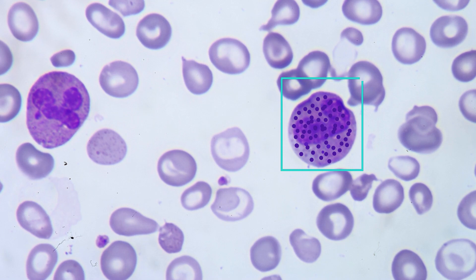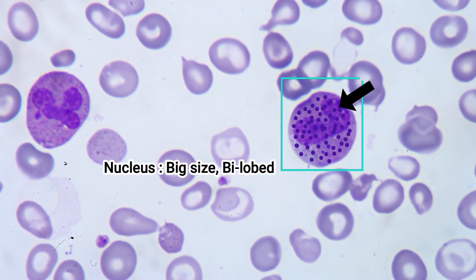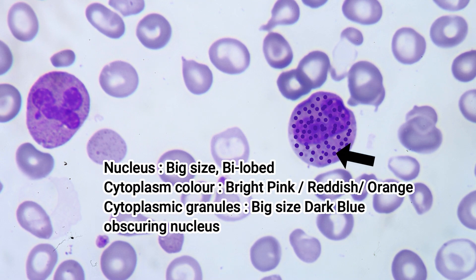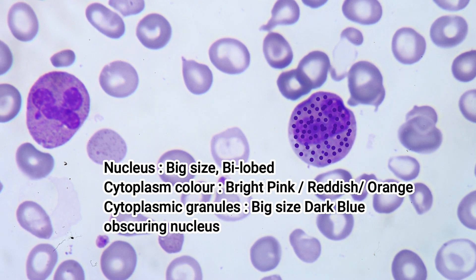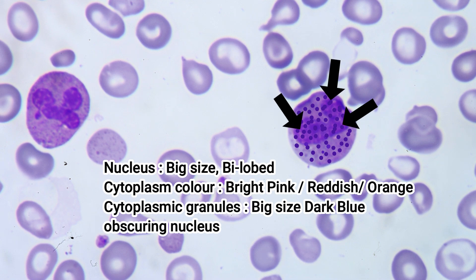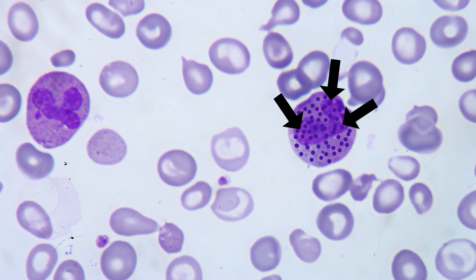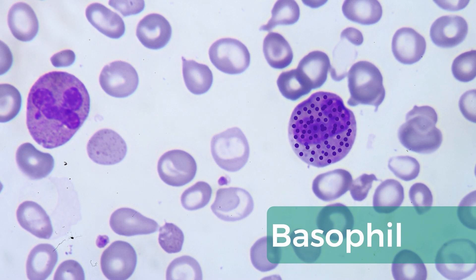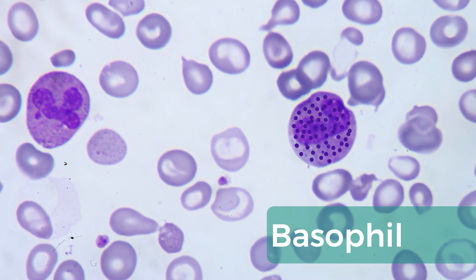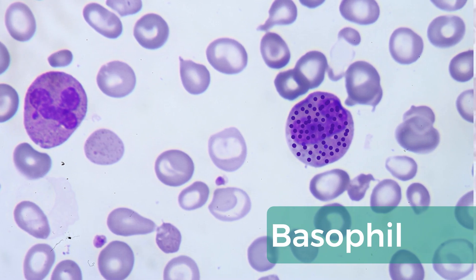Now see this leukocyte. It has a very big lobulated nucleus. Notice the color and size of the cytoplasm granules — it has dark blue or dark purple, bigger or coarser sized granules, and the granules are so numerous that they often obscure the nucleus, meaning you may not clearly see the nucleus through these densely packed granules. Be sure you are seeing a basophil. Remember, basophils are the least in number in blood, about 0–1% of all leukocytes, so you will hardly find a basophil in PBF.